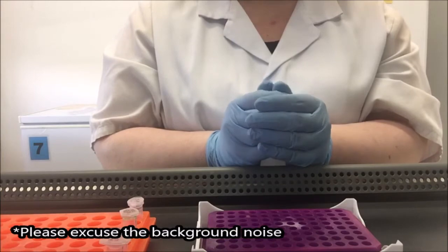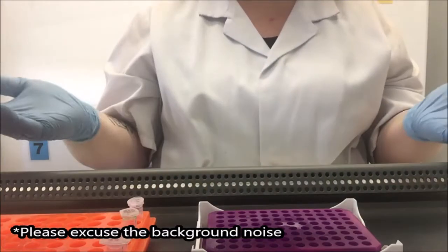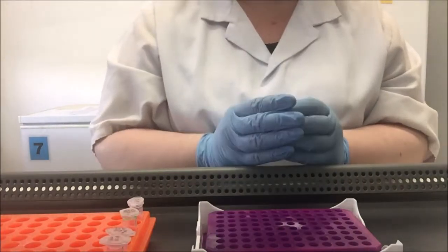I'm now going to do a PCR of the samples we extracted together. I'm currently working inside the clean bench. I've sterilised the camera before I put it in the clean bench.